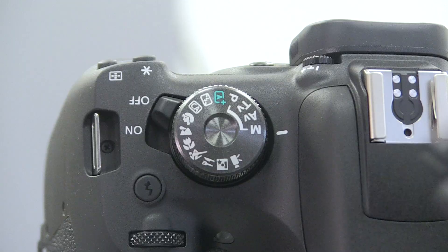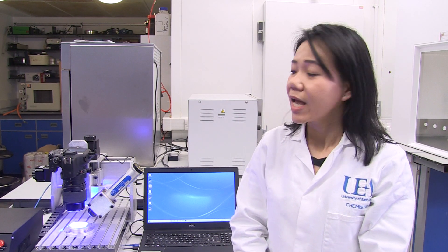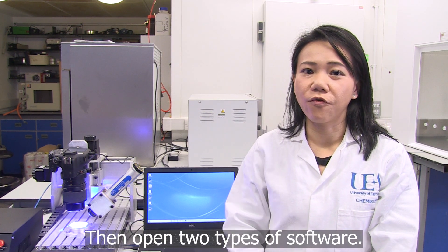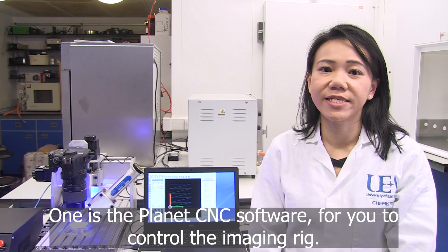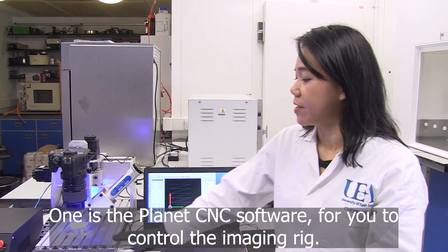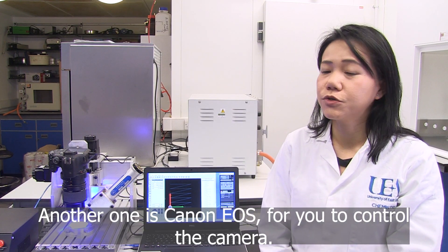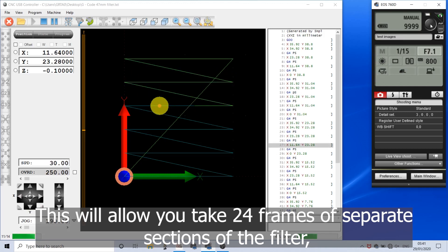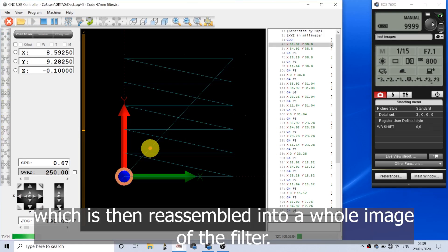In order to start the imaging process, turn on all the power. This is the filter disc in the filter holder. Then open two types of software: one is the Planet CNC software for you to control the imaging rig, and another is Canon EOS for you to control the camera. This will allow you to take 24 frames of the separate sections of the filter, which are then reassembled into a whole image of the filter.